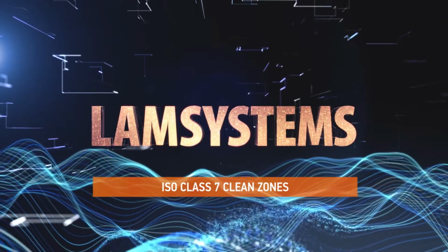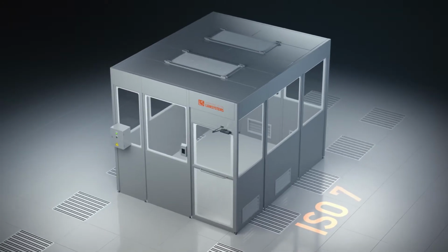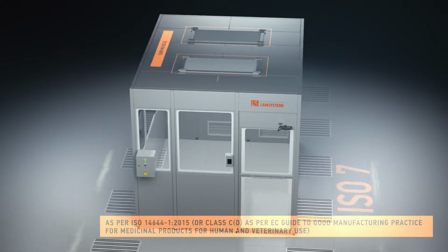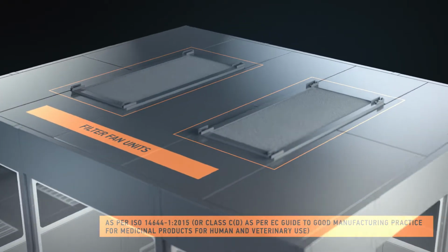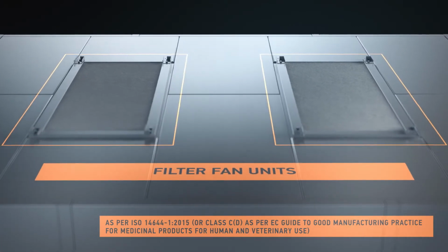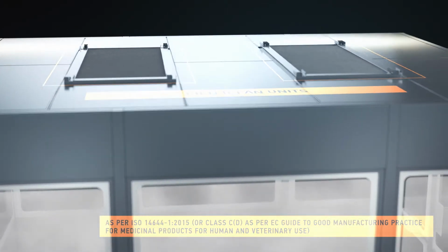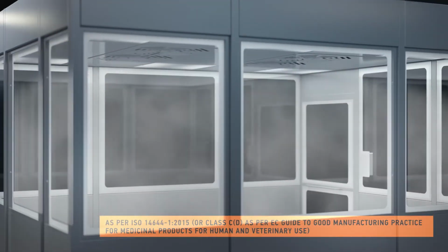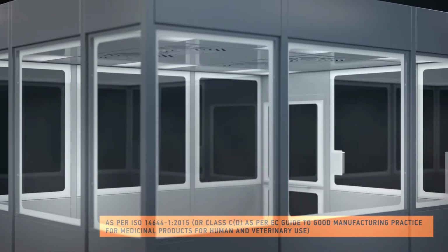A clean zone of ISO Class 7 and lower has only a few filter fan units. Their number is determined based on the required number of air changes inside the clean zone, taking into account its configuration and dimensions. A low turbulent airflow is supplied into the clean zone, ensuring air cleanliness by diluting, reducing the concentration, and removing the aerosol particles.